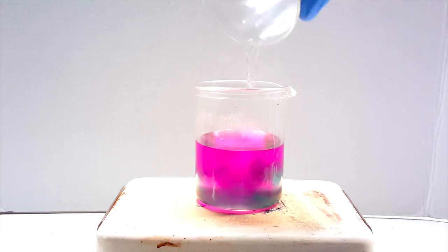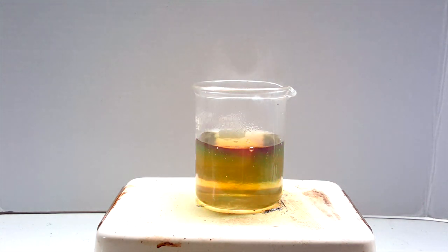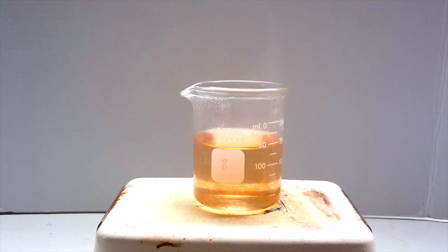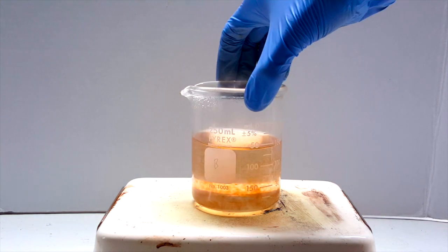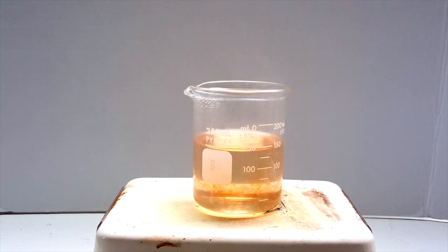This time, the reaction occurred much faster, which had a really cool swirling effect in my opinion. Upon stirring, the colloidal manganese dioxide clumped up much faster and became very visible.